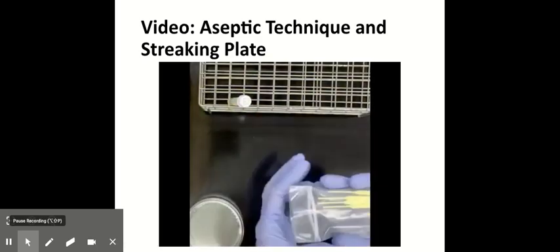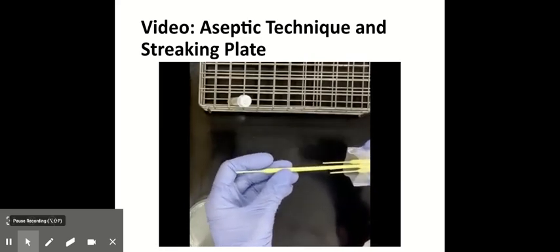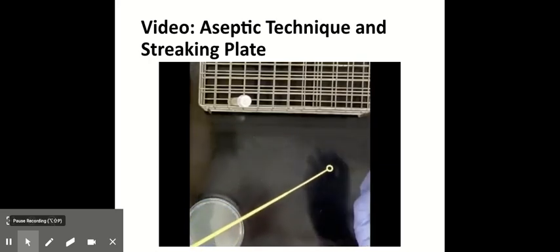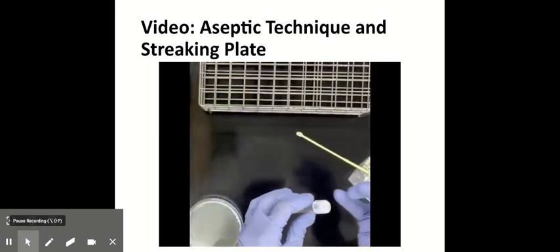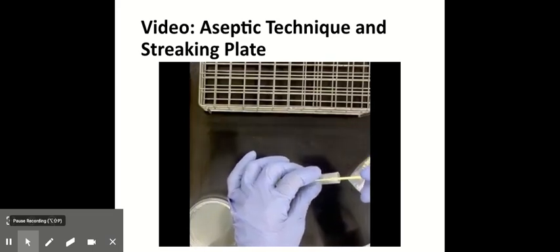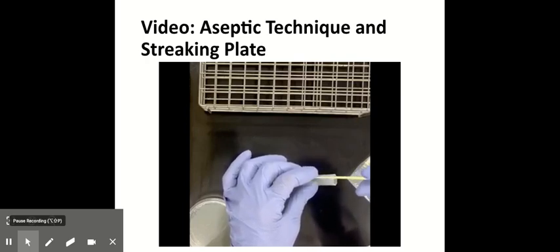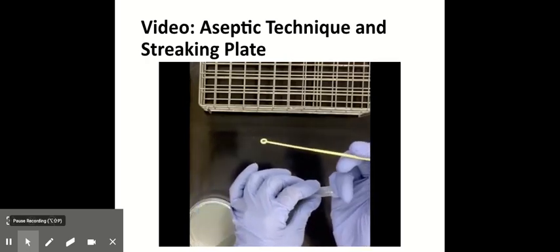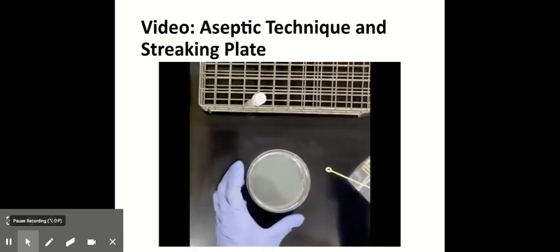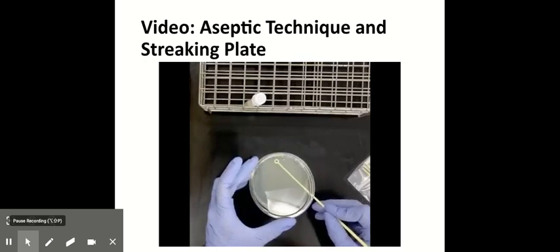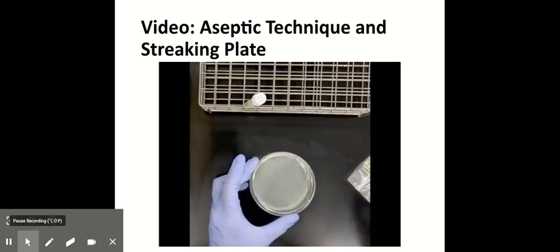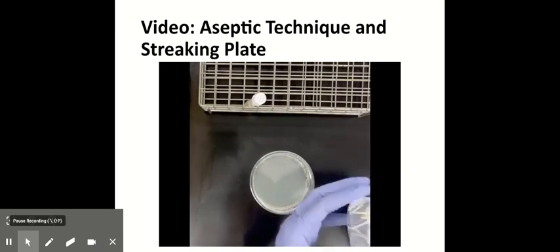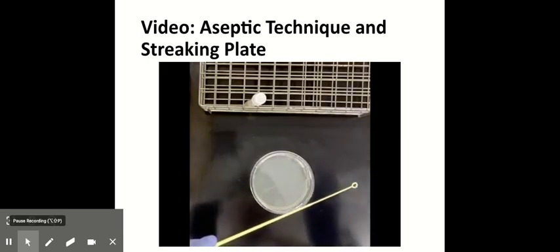So you loosen the cap of your bacterial broth that's there in the rack. And take a sterile loop from the package, being very careful not to touch anything with the loop. Now use your pinky finger to remove the cap. And dip the loop into the culture, gently stirring it. Move the tube away. And you'll see there's a little bit of liquid there on the loop. Now you're going to use that quadrant method. So gently open the plate with the clam shell technique, keeping the lid over it. And you streak the first quadrant. That's the most densely populated quadrant on the plate.